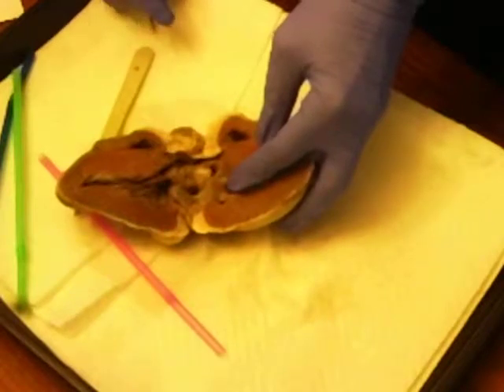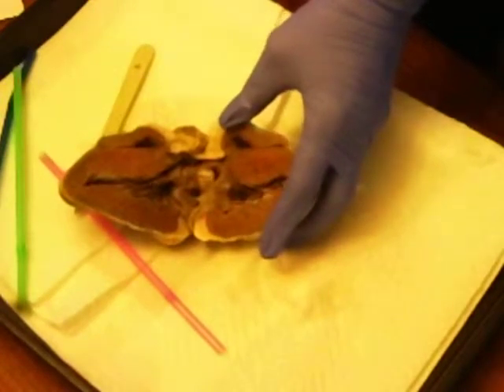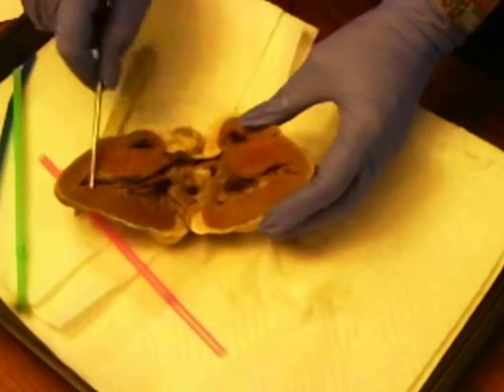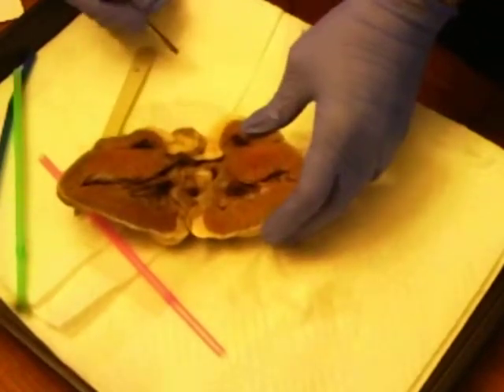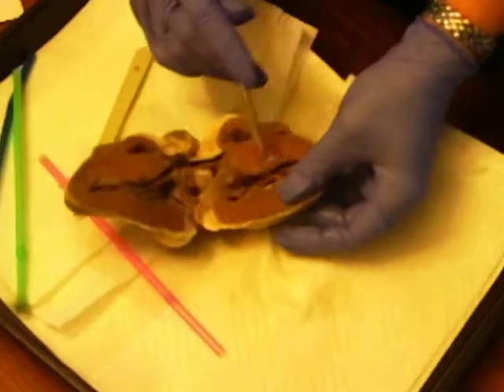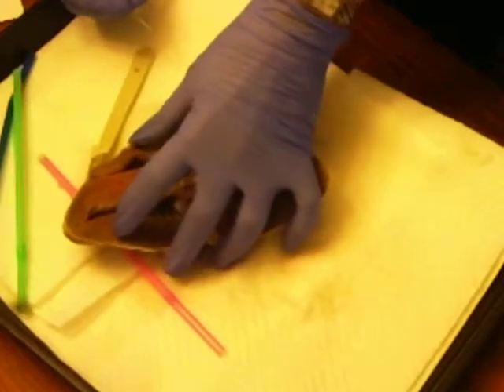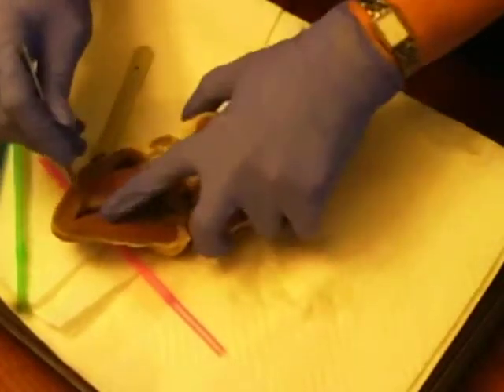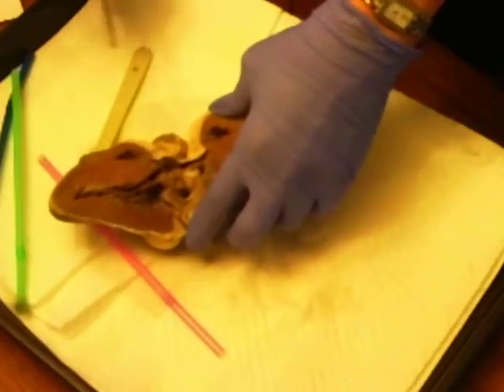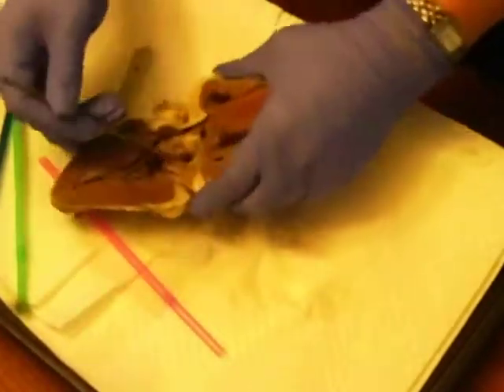And the cusps of the valve, which I am not able to locate. The papillary muscle, which is here, I believe. The tricuspid valve, this is not a great specimen, should be here, if you can see the valve in there. And the pulmonary semilunar valve would be the valves down here, and then back up to the aortic semilunar valve, which would be the aortic valve from the top. So it should be this large valve here.